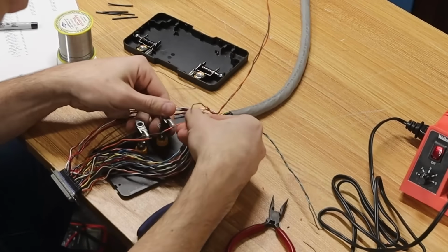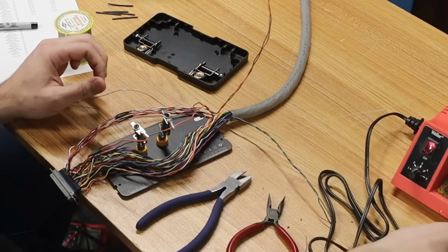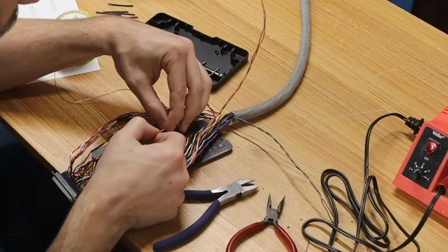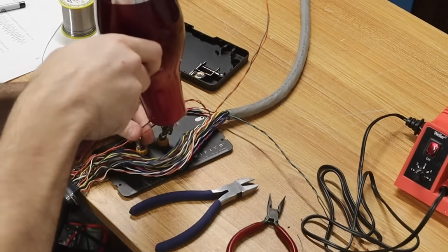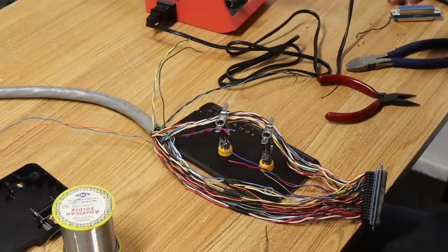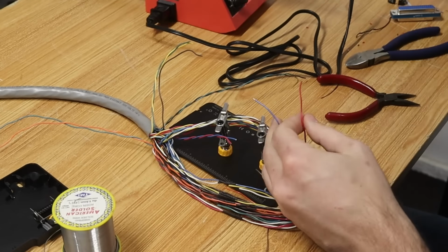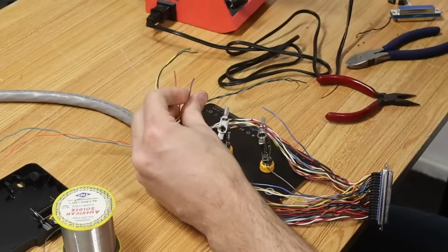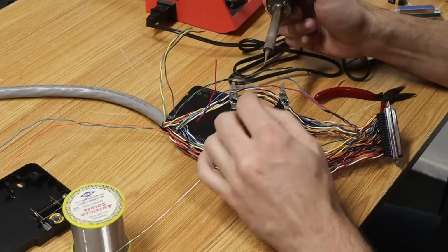However, my return paths are a bit of a mess. The cable is made up of 25 twisted pairs, and those are connected with the appropriate return paths for the IEL-61. I'll need to essentially remake the cable from scratch if I want to get all the return paths lined up correctly. But let's start with just getting basic communication happening. If we discover later that we need to sort the return paths better, we'll deal with that at that time.